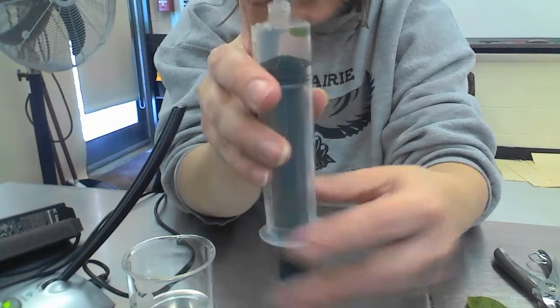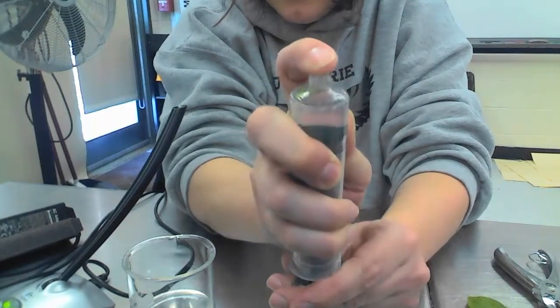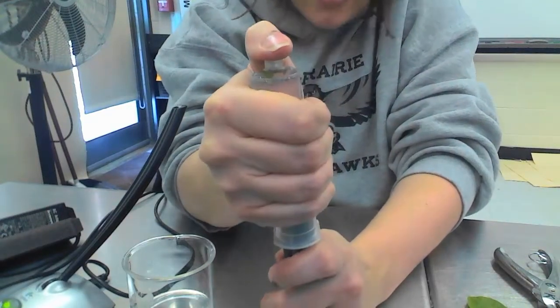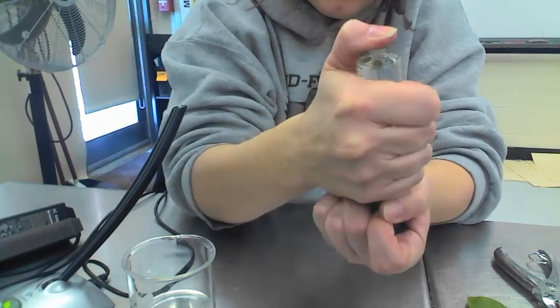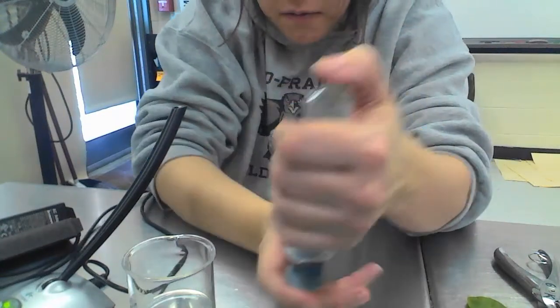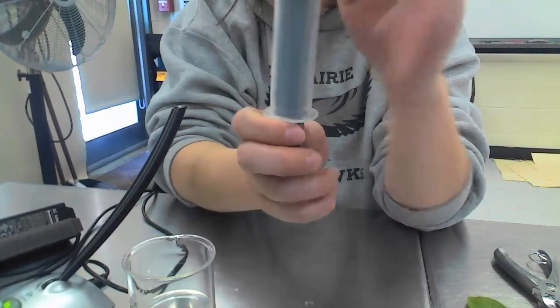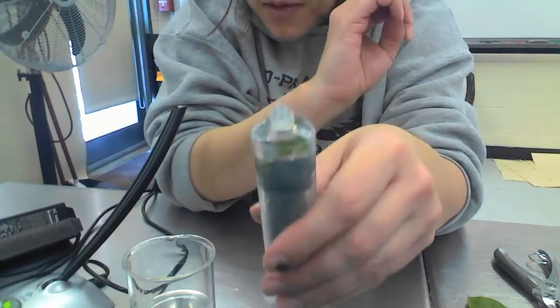Then I'm going to put my finger over the area where there normally was a needle, and I'm going to pull. What I'm doing is creating a vacuum to cause all those air bubbles to come out of the leaf. Oops. As you see, water. If I do it well enough, you can start to see that some of the chads are falling down to the bottom because I sucked out all the air bubbles from them. So you can start to see they're falling.